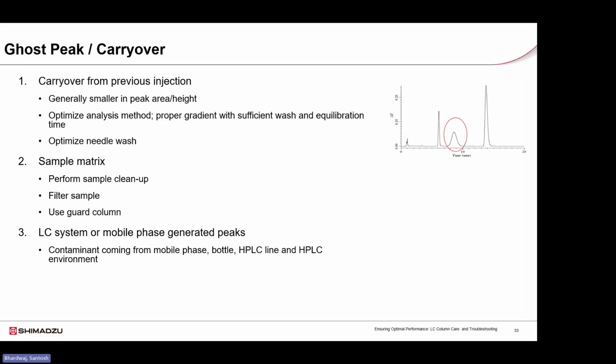Carryover peaks are sometimes mistaken for ghost peaks. These are smaller and most commonly caused by insufficient needle washing. Carryover can be eliminated by using an appropriate rinsing solvent and optimizing method parameters, such as rinsing before and after the sample aspiration and ensuring adequate needle dip time at the rinse port. Carryover often occurs due to the injector or needle. By carefully controlling these factors, both ghost peaks and carryover can be effectively reduced or eliminated.